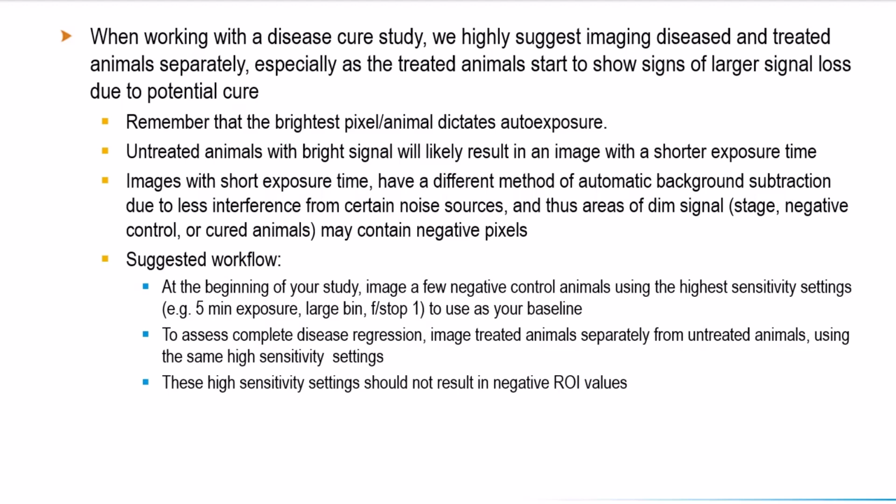Mice with a higher signal will require lower exposure times. This will increase the potential for negative measurements on your control mice. After that, background subtraction is performed by the software. We recommend imaging your control animals manually using the highest sensitivity settings possible. An exposure time of 5 minutes, an f-stop of 1, and a binning of 16.